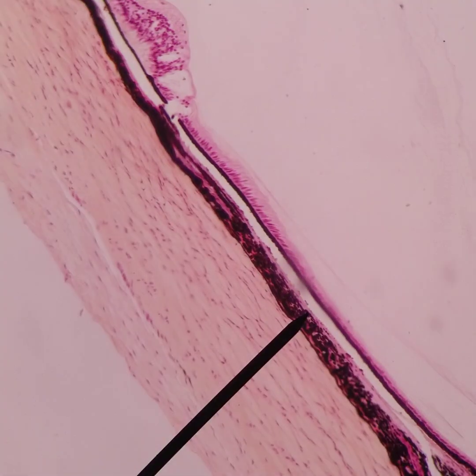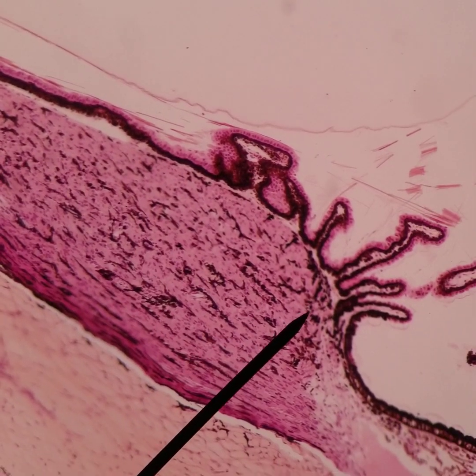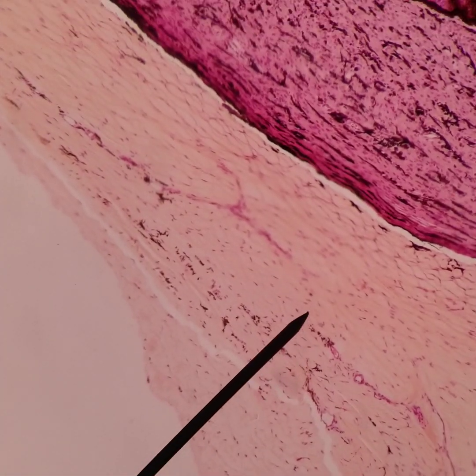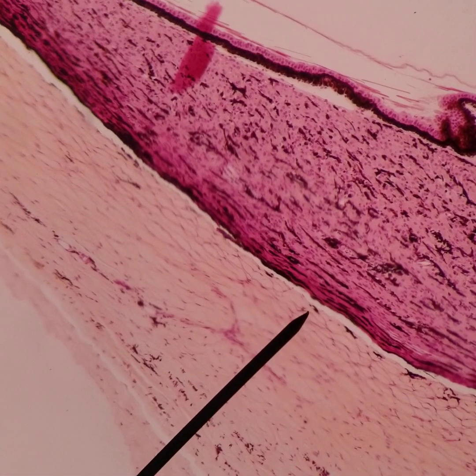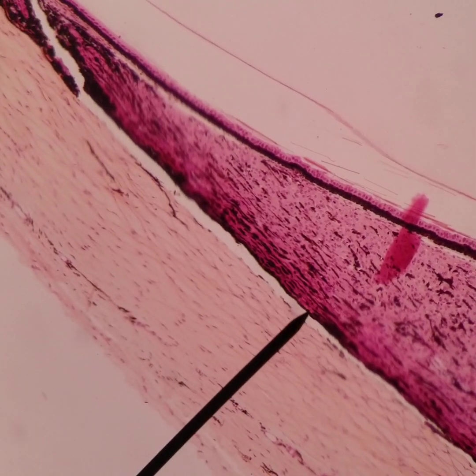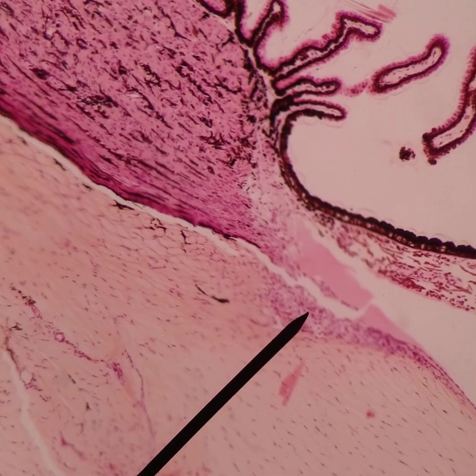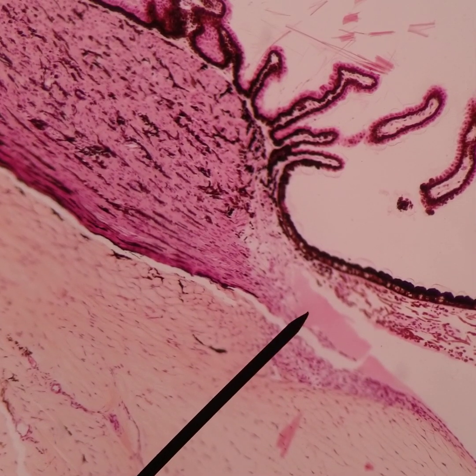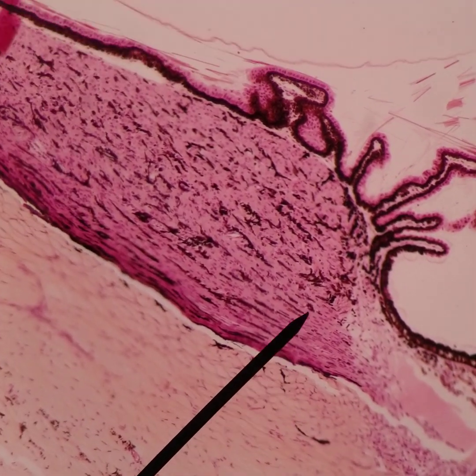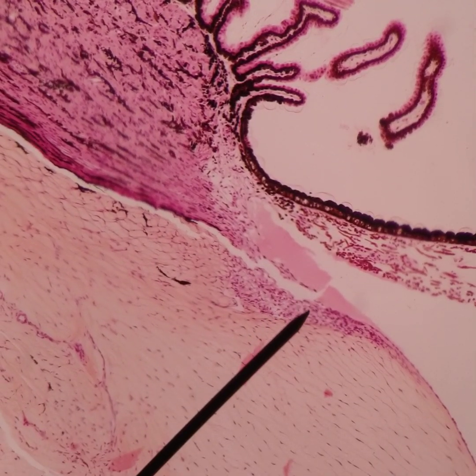Now let's take a look at the iris. Remember there's also the suprachoroid near the ciliary body — the supraciliary — so there's that potential space you can kind of see on this side. The stroma of the ciliary body is continuous with the stroma of the iris.